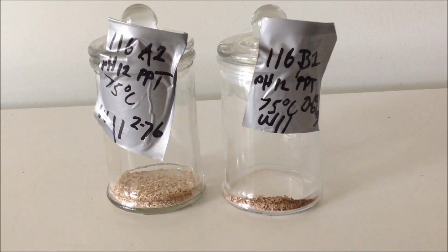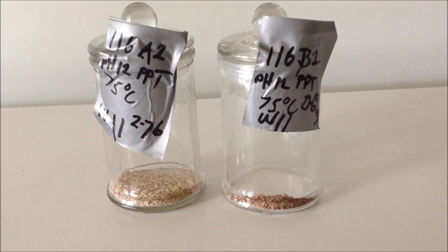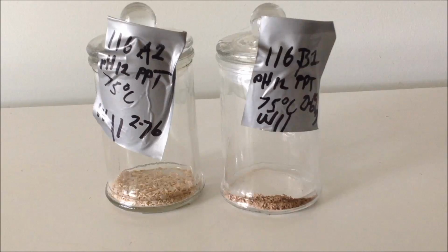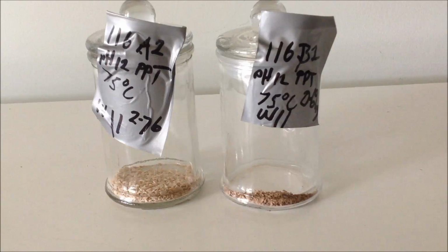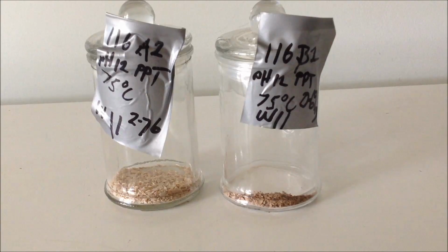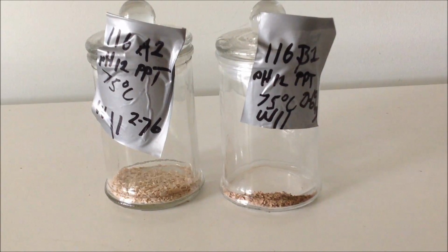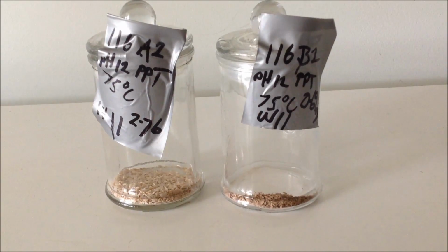I could have done a volume and mass check and worked out something from that, but I didn't, and I really don't want to do it all over again. Anyway, I think I'll just proceed with my test to heat it up to 350 degrees C and see if we lose an expected amount of mass. Now, I did check the oil temperature in my standard oil bath method of drying it out, and the oil temperature was 170 degrees C, so it's nowhere near the 350, not that it would have counted for that much mass loss anyway, but I'll press on.